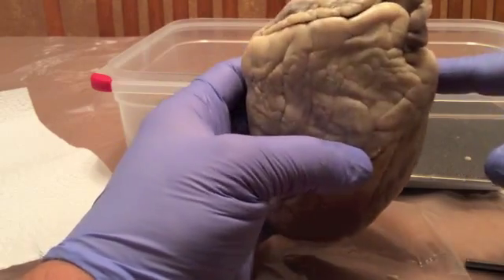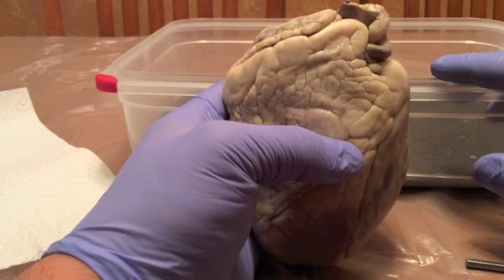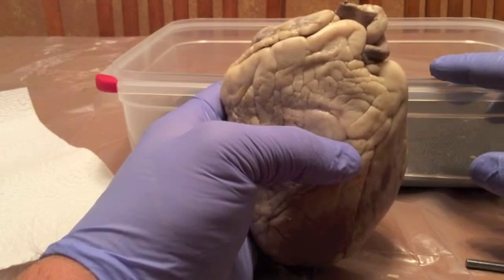So this is just the overview and the review of the dissection of the heart for Human Anatomy 235 for Azusa Pacific.